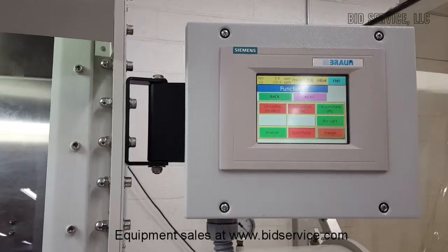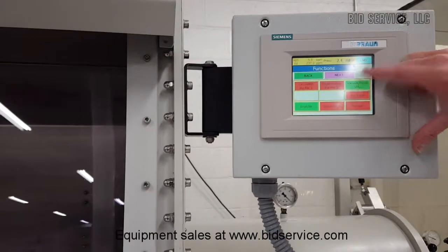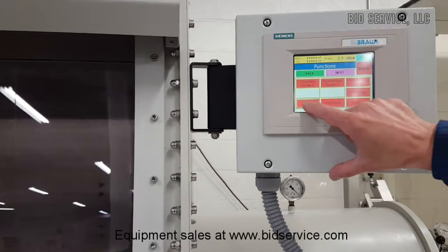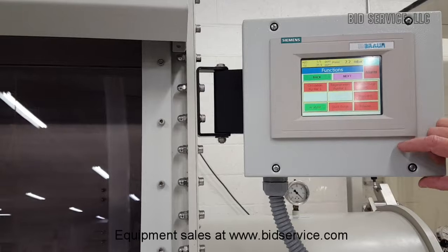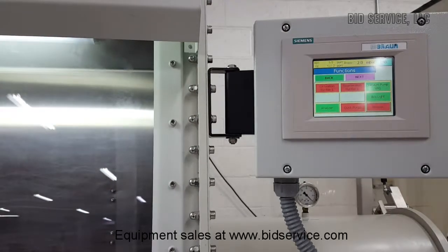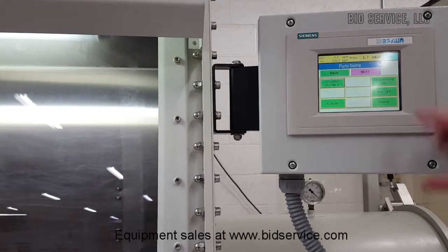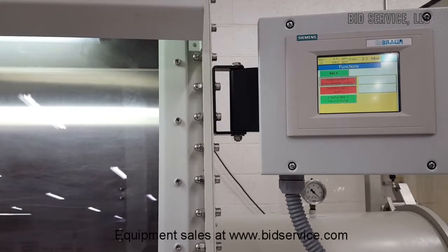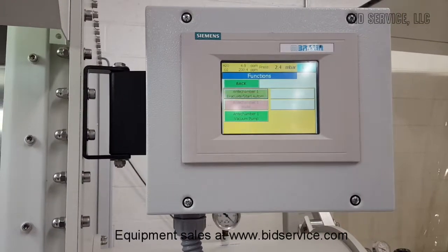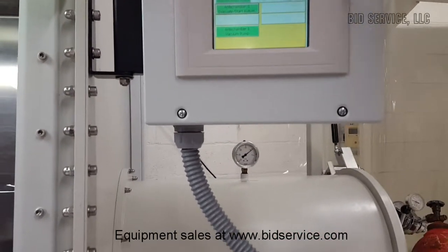Some other functions here — you can turn your freezer on and off, your glove box light, you can see the light went out. You can control your vacuum pump and also control the analyzer — I'll shut that off and you'll see these numbers go off. Turn that back on. Turn the pump on, light back on. The freezer is on and your circulator is on — this is normal operation for the system. You can also do your antechamber evacuating and refill from here. You can see the vacuum coming down in the inner chamber. There's more than one way to get to certain screens.